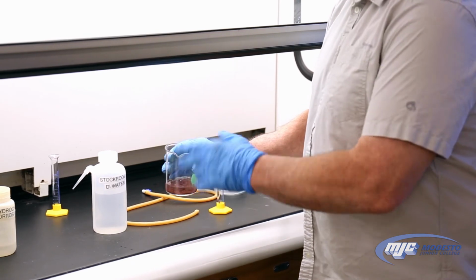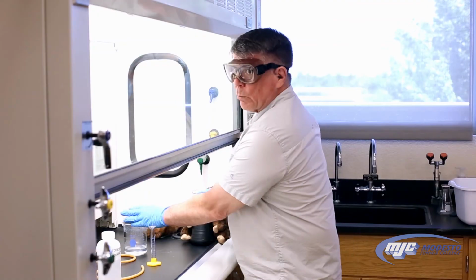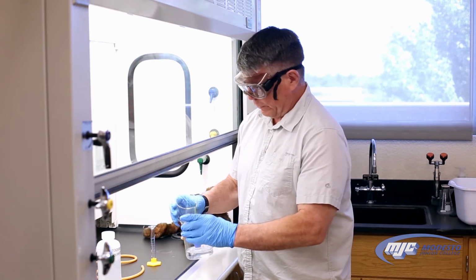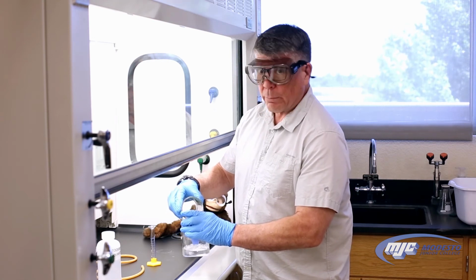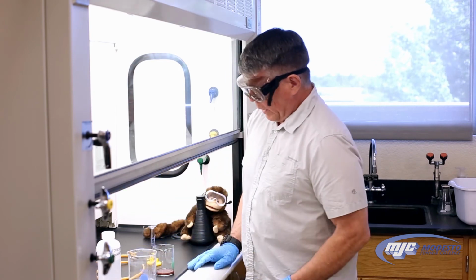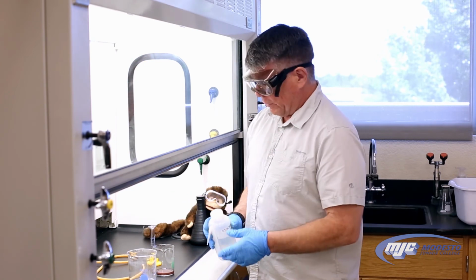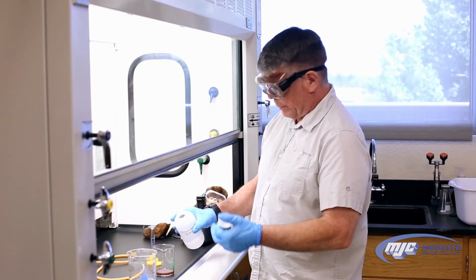So we know that the reaction's finished now, guys, because no more bubbles. All the zinc's gone. What we do now is we decant the liquid into our waste beaker, same waste beaker. Again, being as careful as we can not to let any of that copper be transferred over. Doesn't matter if we don't get all the liquid. Now we're going to wash it with water two times, about 50 mils. I'm not going to even measure it out. I'm going to use the marks on here. The exact volume really doesn't matter.